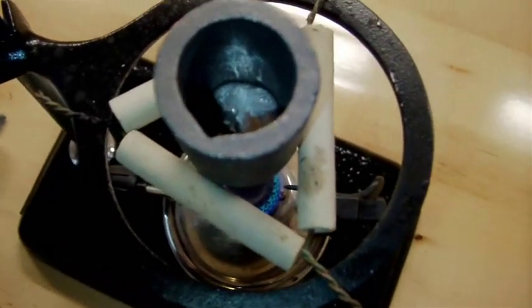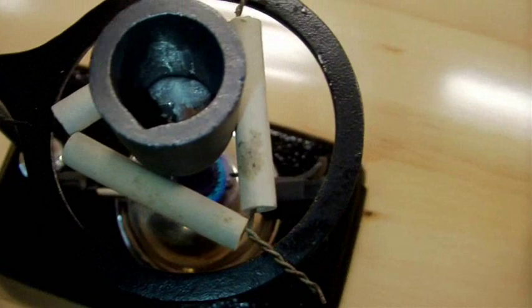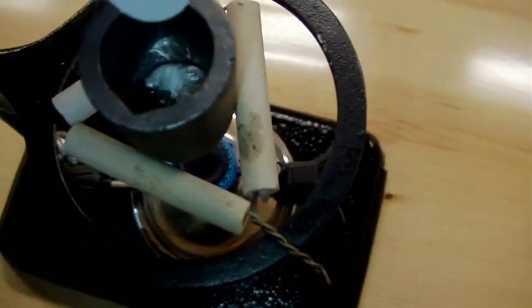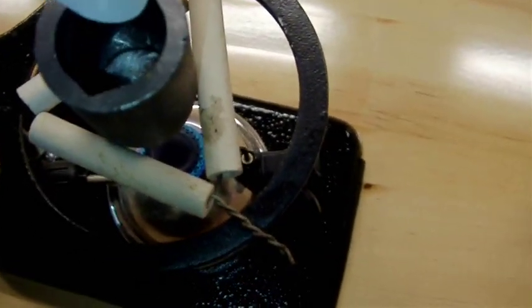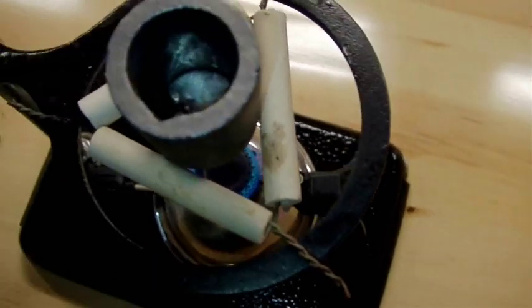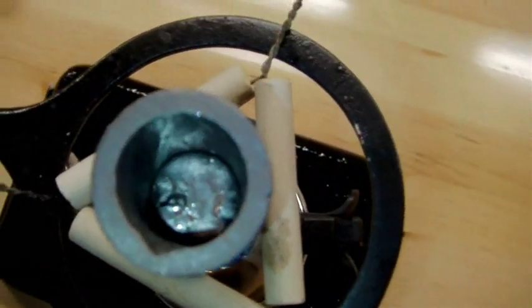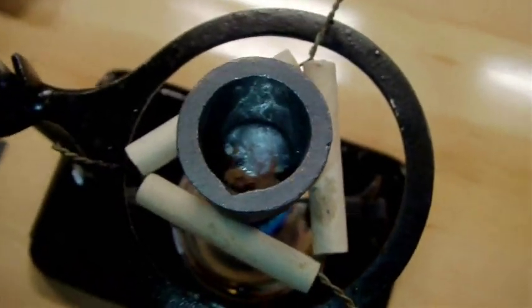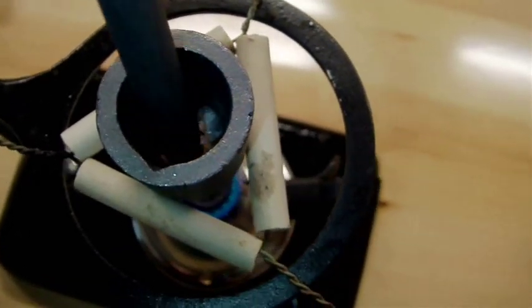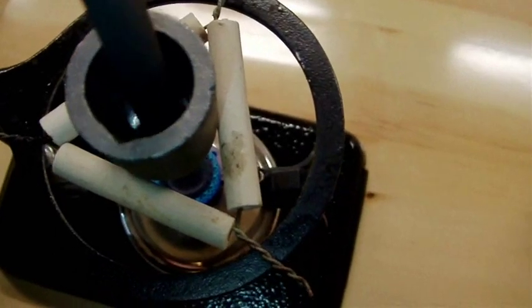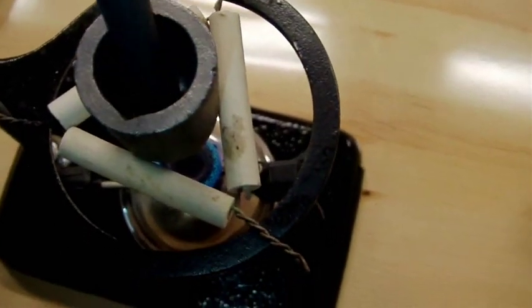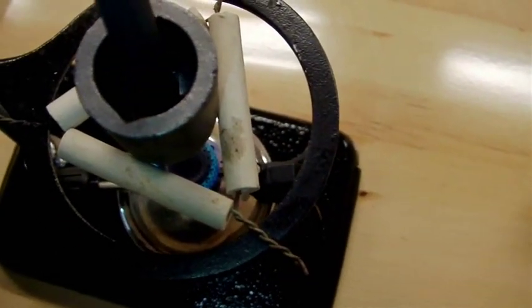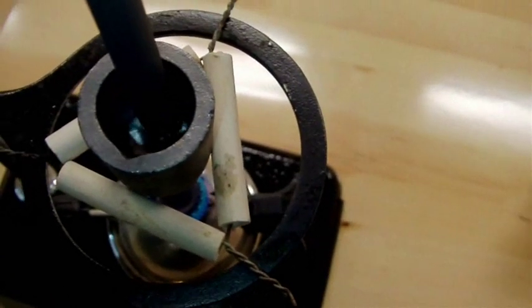So you can see it's already pretty much a big liquid mass. But as I said, that's mostly the gallium. It'll take a bit longer for the other ingredients to melt as well. And the way I'm going to find out if they're melted, I have another piece of graphite, just a rod that I'll use to sort of stir everything around. And once I don't feel anything hard in there anymore, then it should be ready to go.